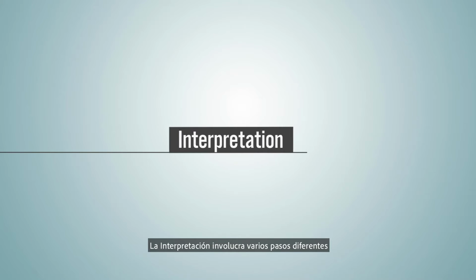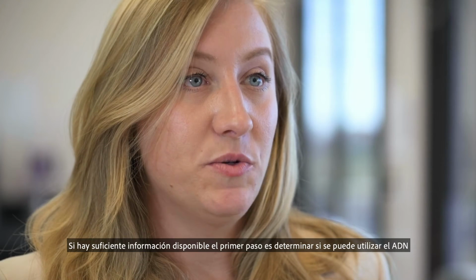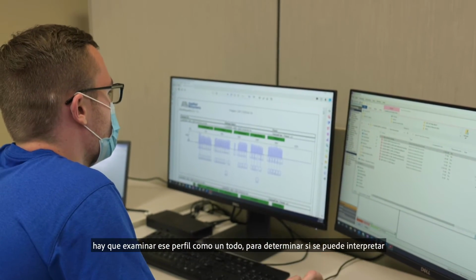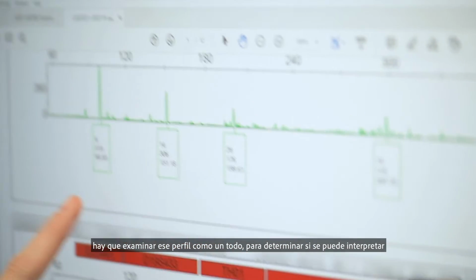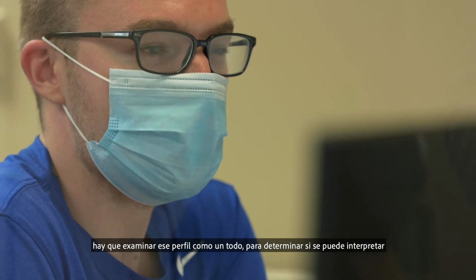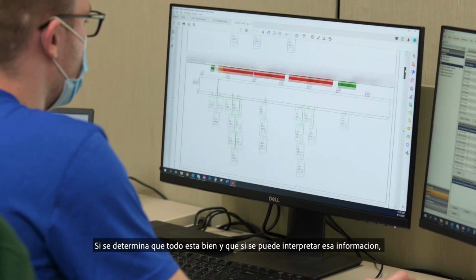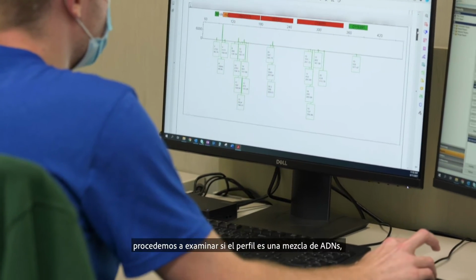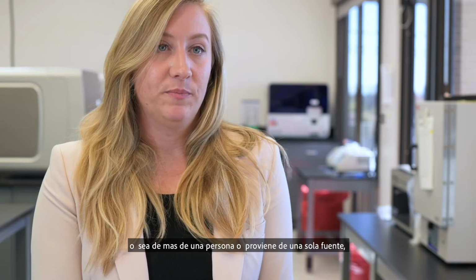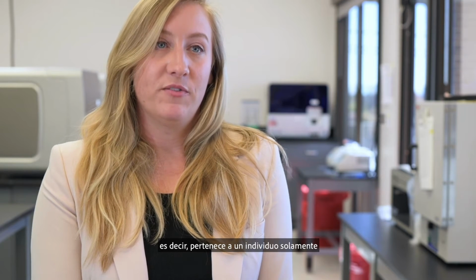Interpretation involves a few different steps. The first step would be determining whether that DNA profile is usable. Is there enough information present? Is there too much information present? So it's all about looking at that profile as a whole to determine if it is able to be interpreted. If you determine, yes, I am able to interpret this data, the data looks great, then we would determine, is this profile a mixture? Is it from more than one individual? Or do I think this is a single source profile, meaning it's from only one individual?